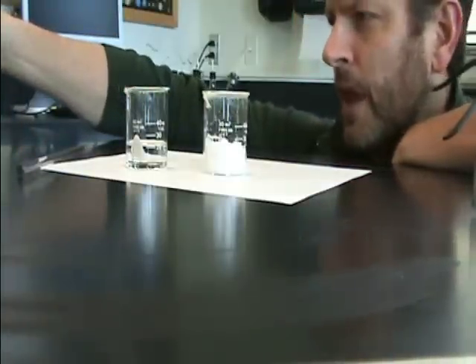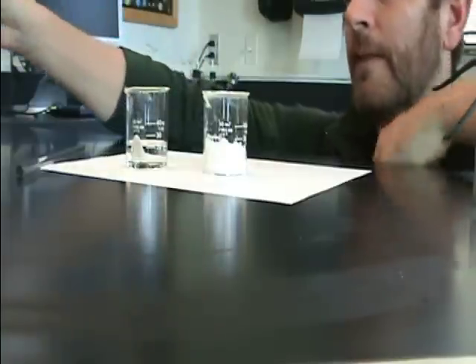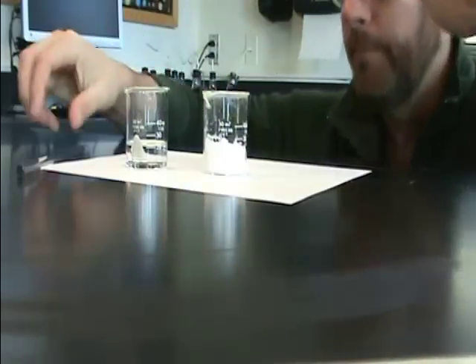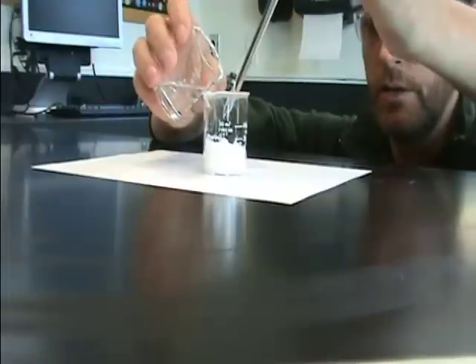All I'm really going to do is mix them together and a chemical reaction will take place. I'll talk a little as it happens. I am going to add just a bit of water to the sugar first — it sort of helps things out a little to get rolling. Safety goggles, of course. Let's take our acid and carefully pour it into the sugar.